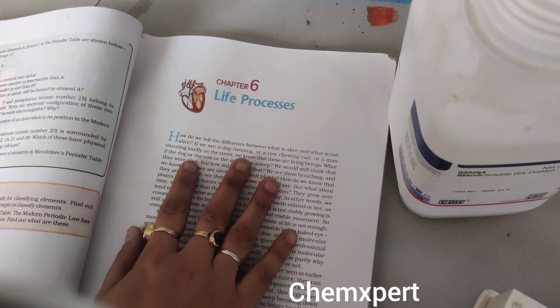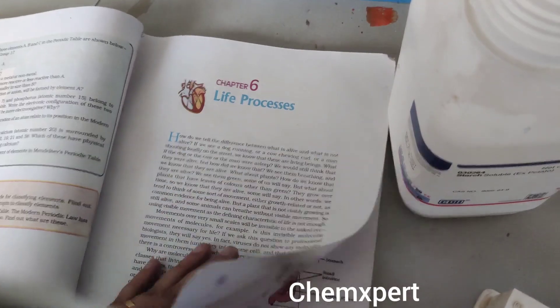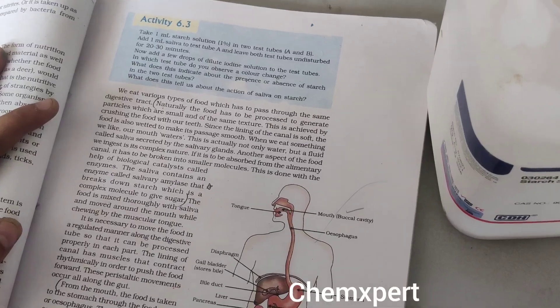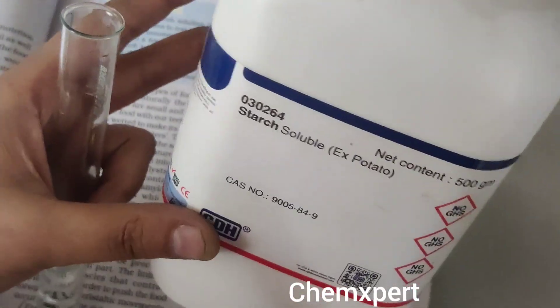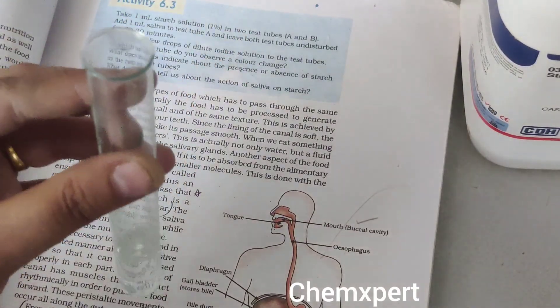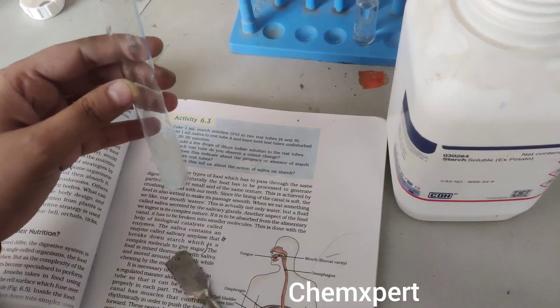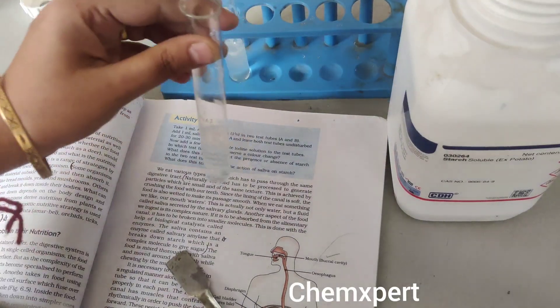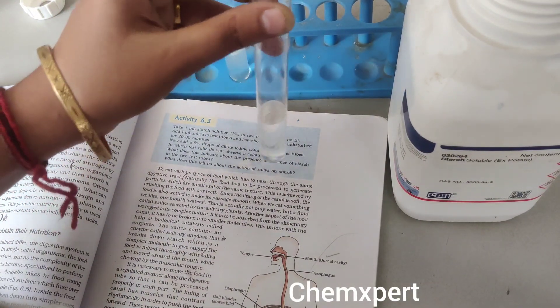Hello everyone. In this video we will perform the activity of Chapter Life Processes, Class 10 Science. This is the third activity of the chapter, where we have to take a starch solution into a test tube. First of all, we will prepare the starch solution. I am taking solid starch and adding it into a test tube containing water. Now the starch solution is prepared. Similarly, in another test tube I will also add starch and prepare a solution.